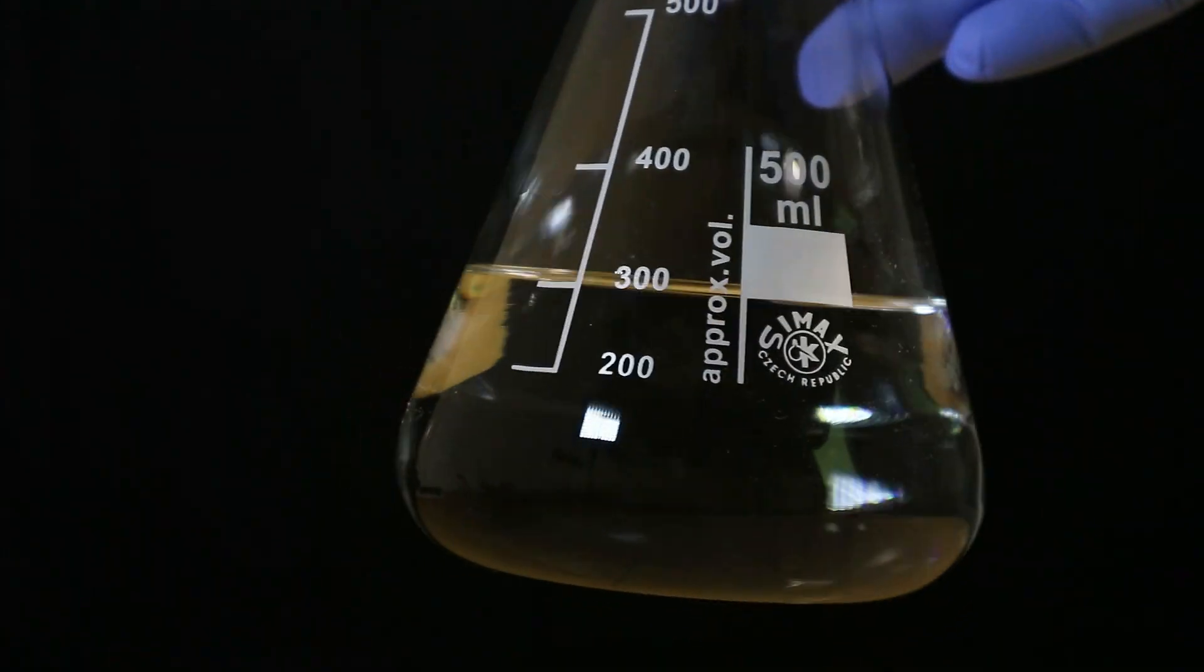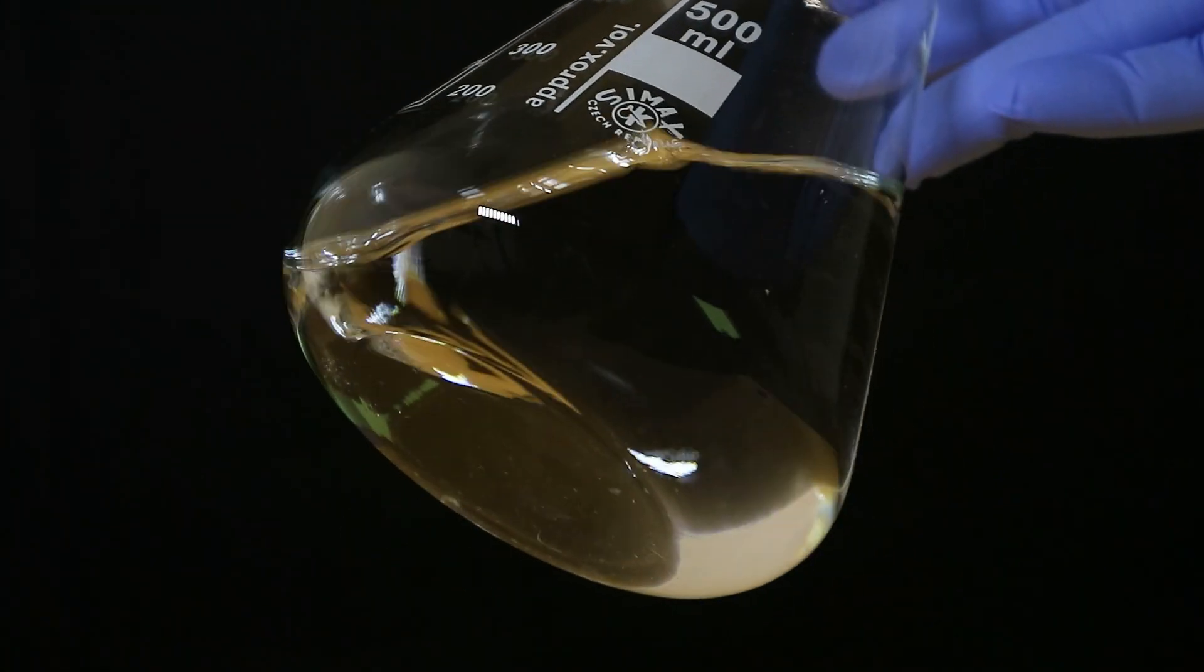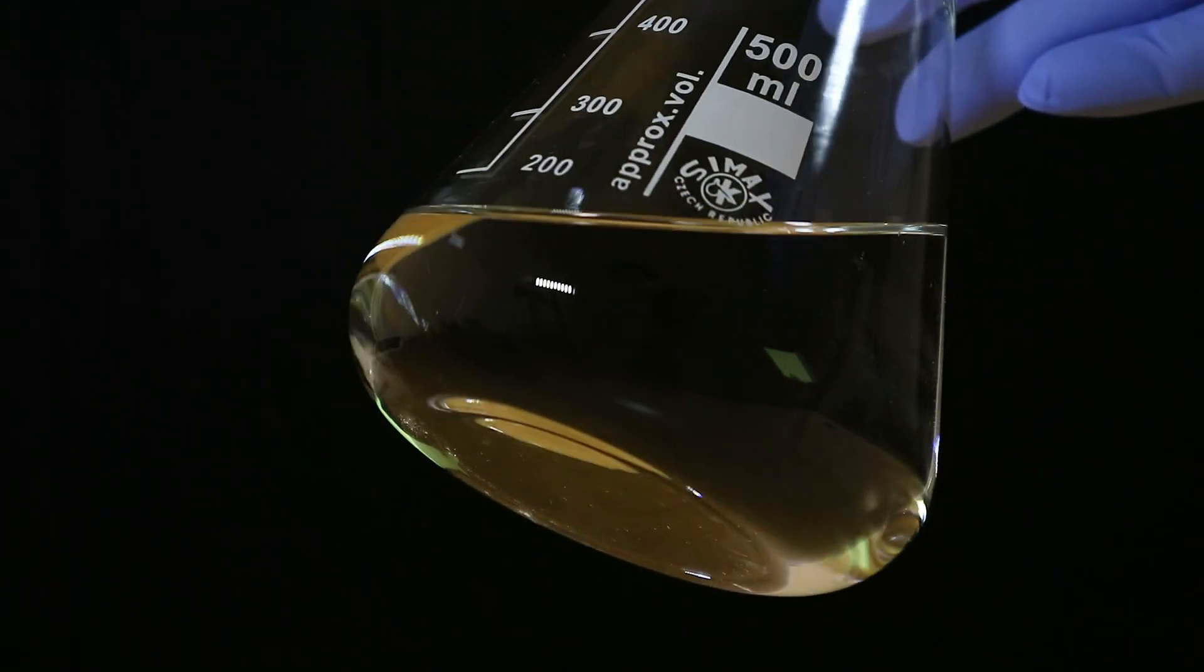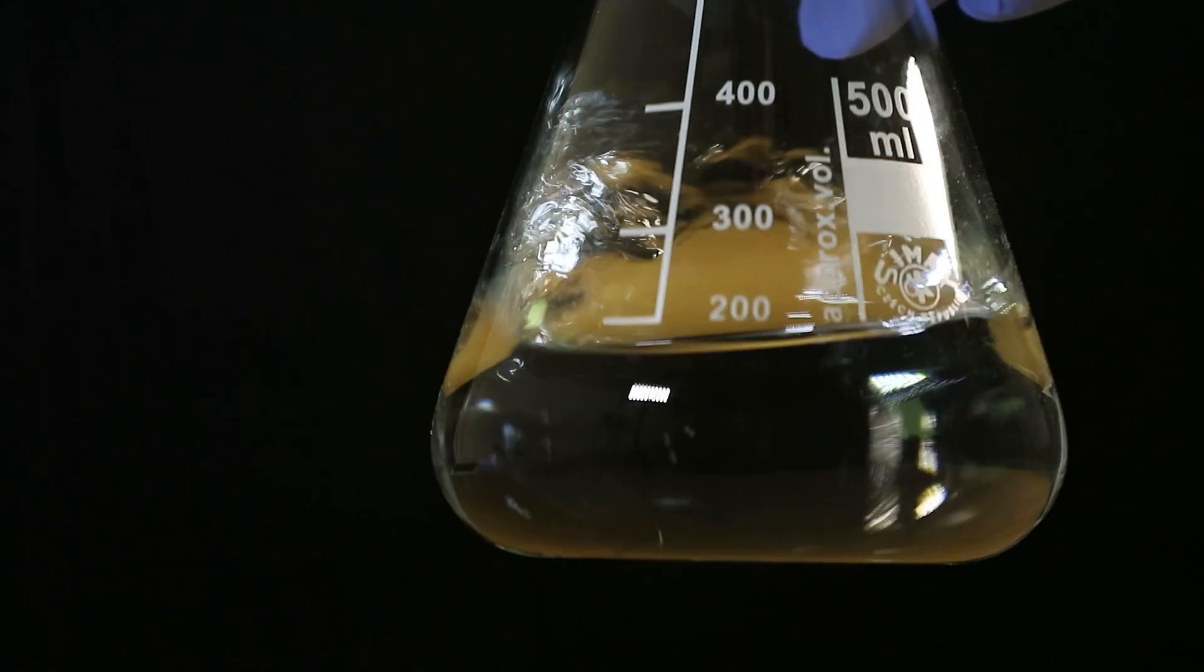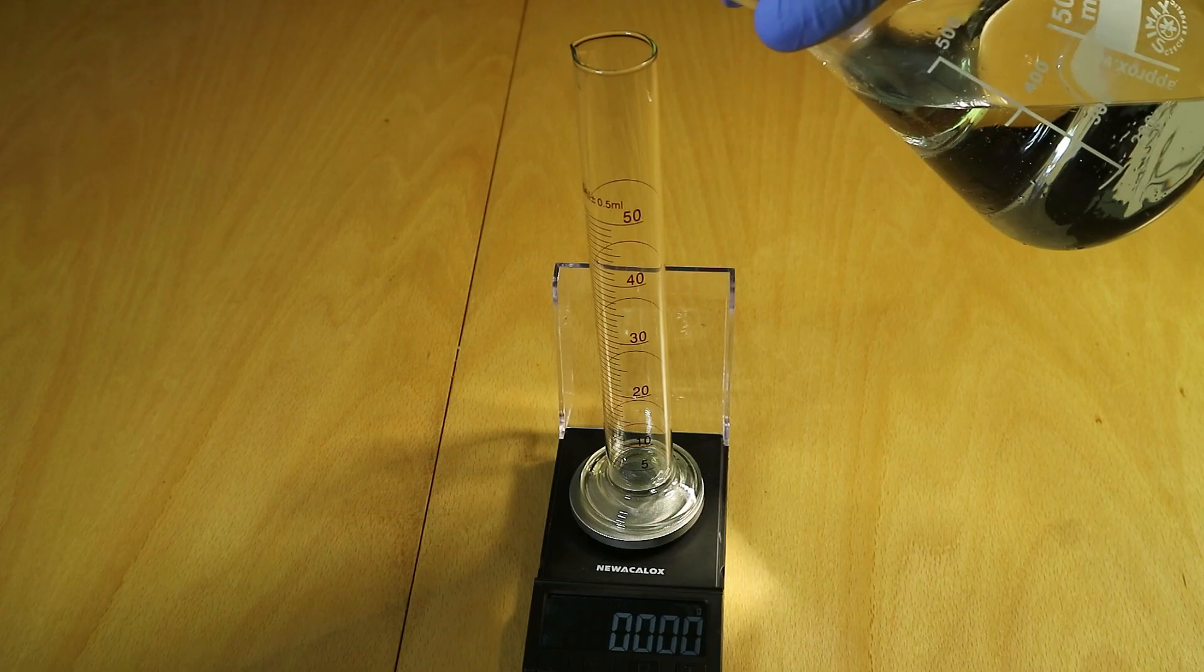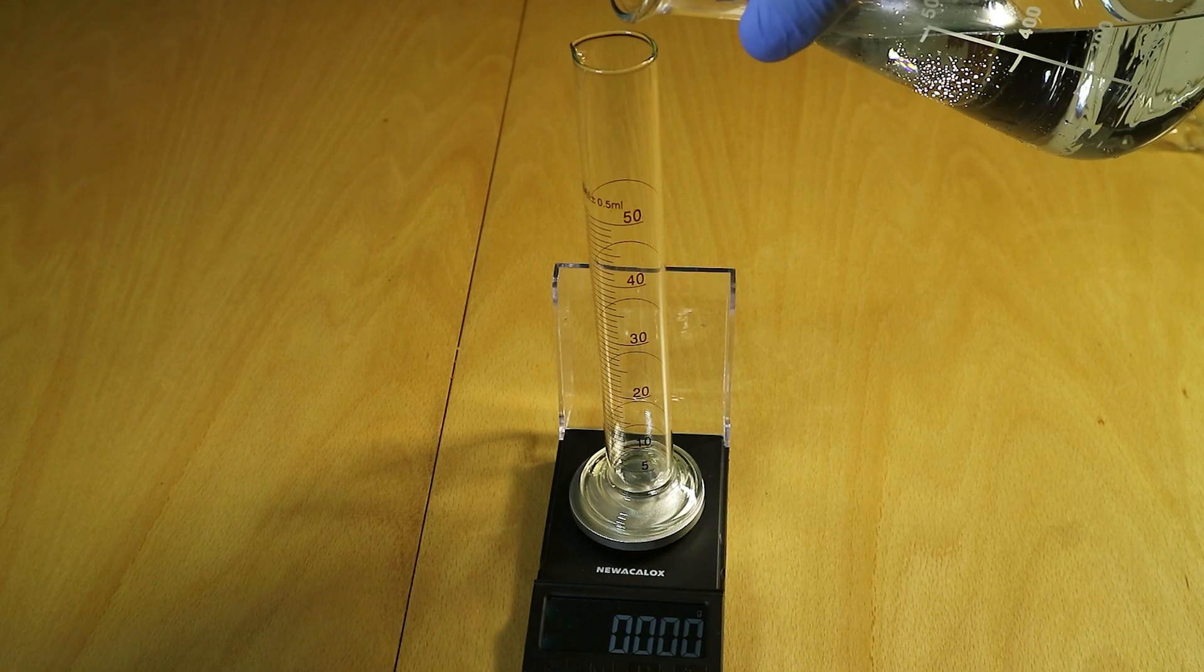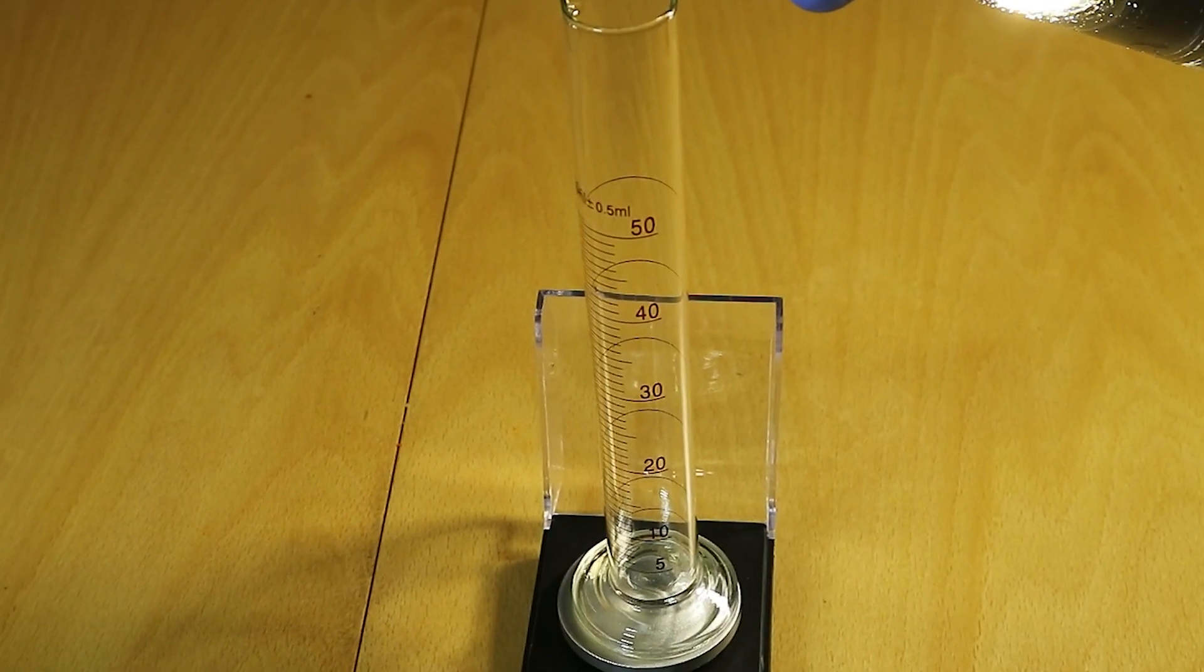Well would you look at that while we were talking we finished the second distillation so now we can check its concentration by calculating its density and checking against the table and see if we've reached the 95%. Spoiler alert we didn't but actually I didn't expect it to and we actually got more than I expected.